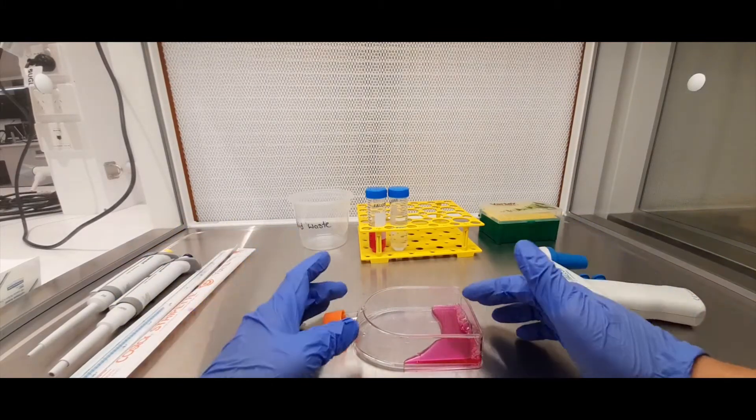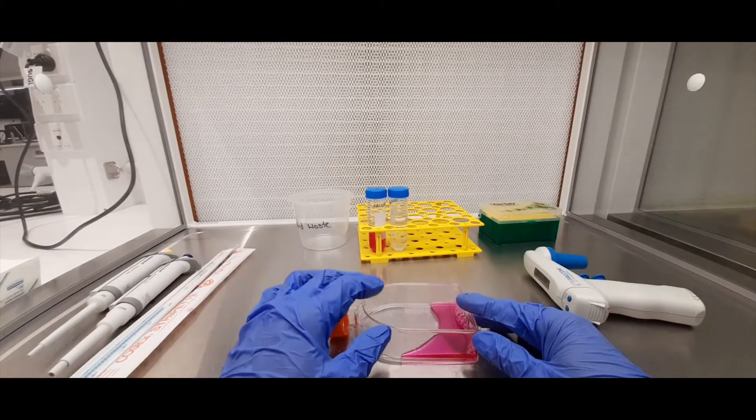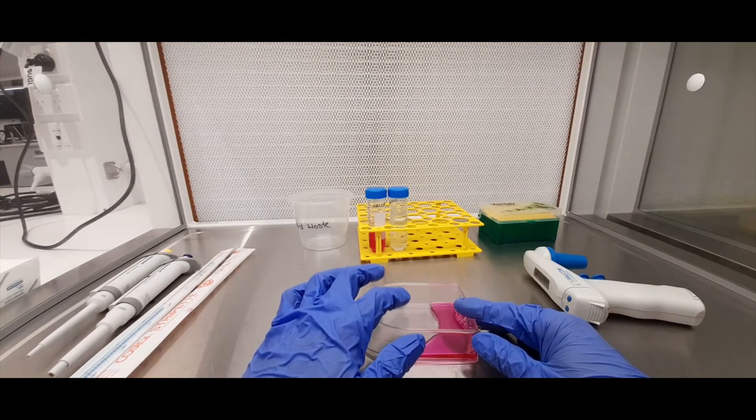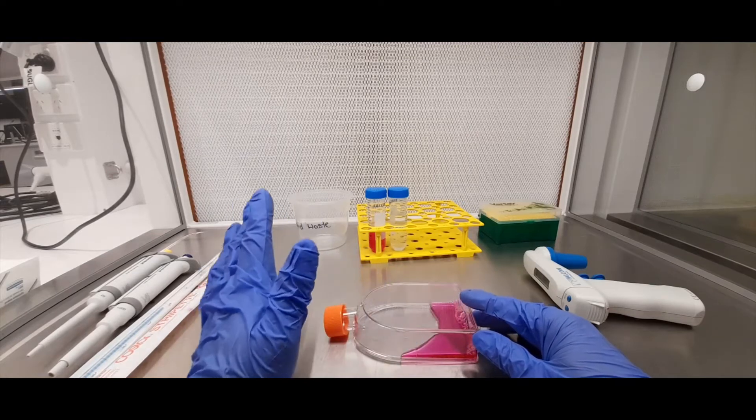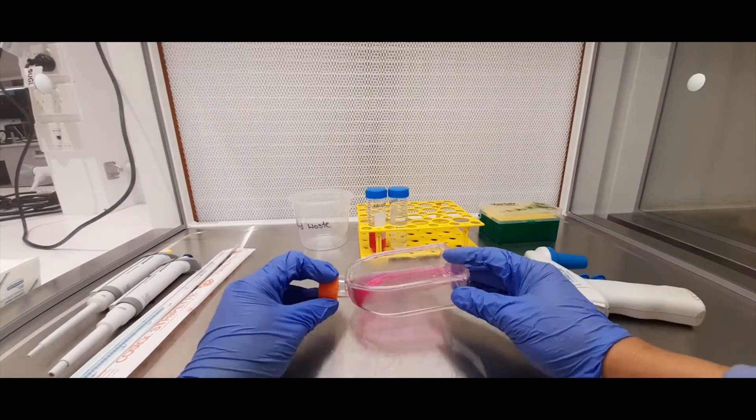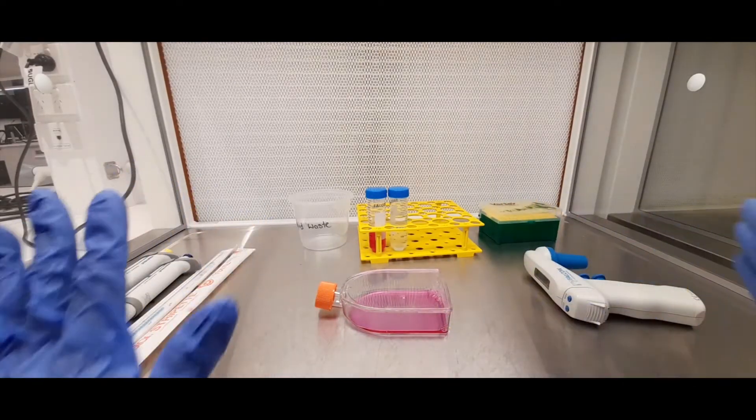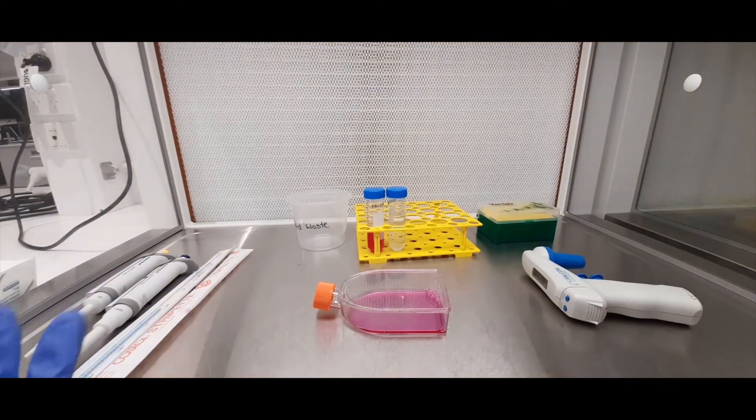The flask isn't designed to be like that. And again, your cells which are stuck here at the bottom will eventually dry out and die if you have it positioned like this for any prolonged period of time. So your cells, when they're sitting in the hood, should be positioned like so.